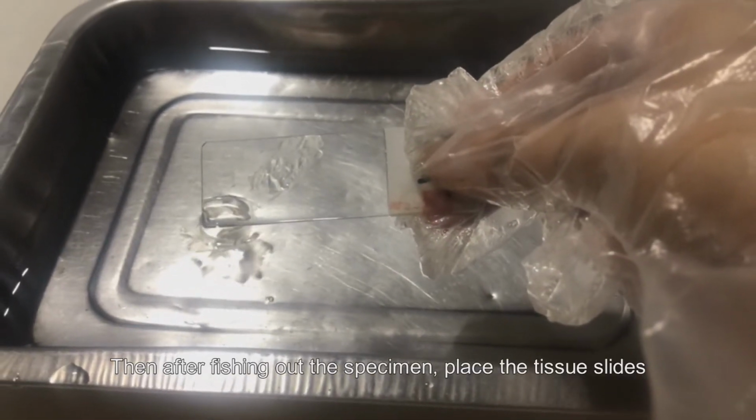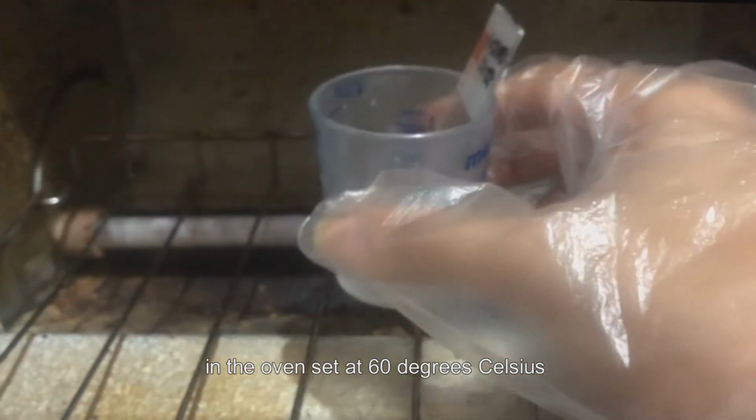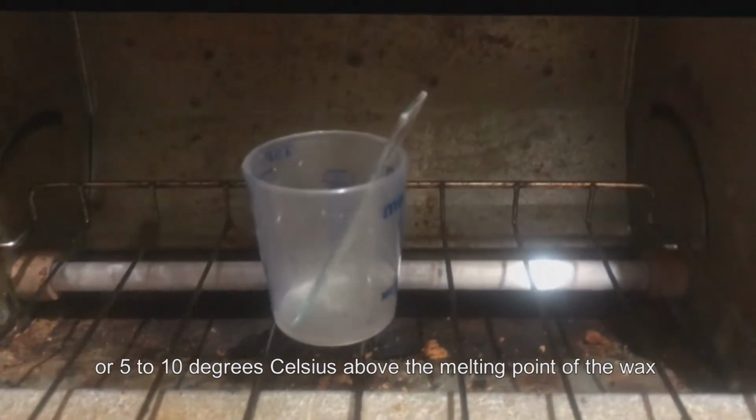Then, after fishing out the specimen, place the tissue slides in the oven set at 60 degrees Celsius or 5 to 10 degrees Celsius above the melting point of the wax for about 30 minutes.